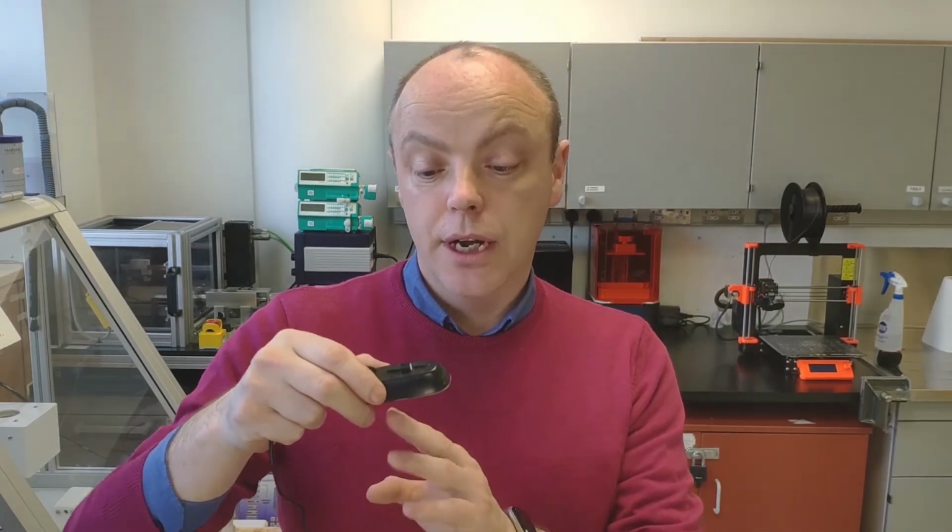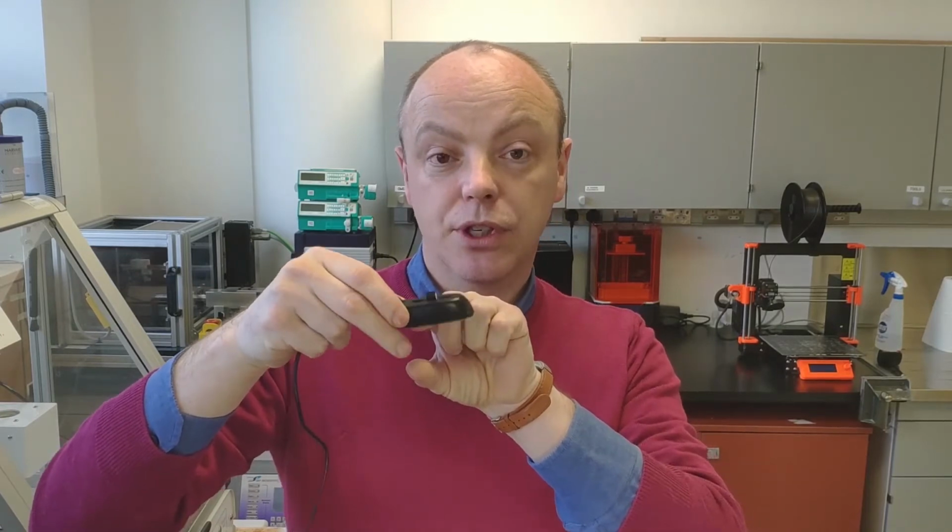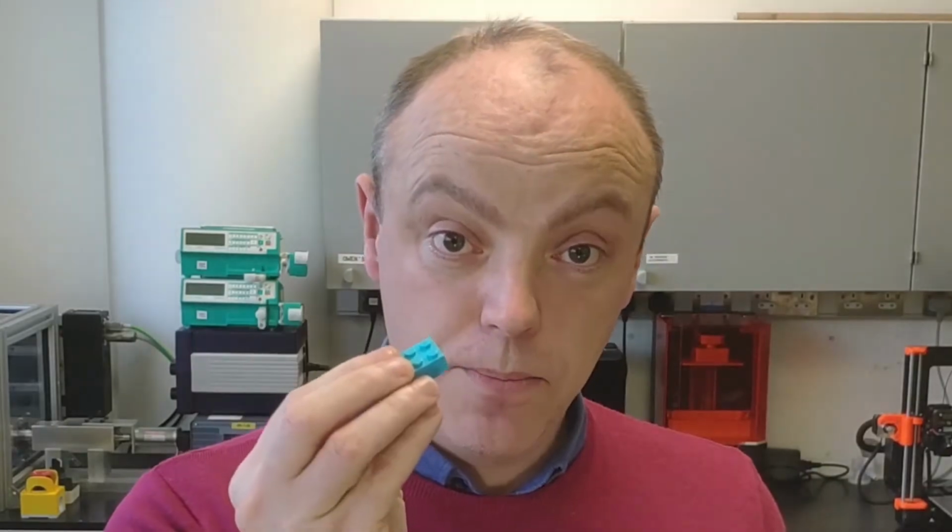So when you're using a little simple microscope like this, one of the things that's going to make it much easier to use is to have a little stand for it. And what a stand will allow you to do is to hold it at a fixed height above your sample. And that's going to hold it stable and make it much easier to actually work with. So what can you use to make a simple stand? You can make it out of anything. And what I find really useful is Lego.